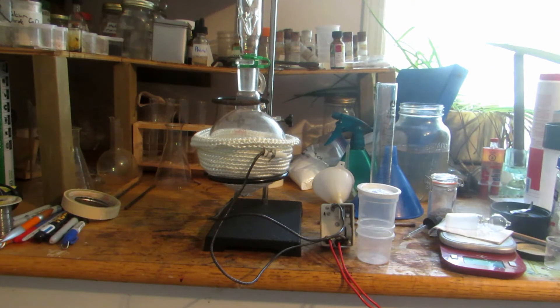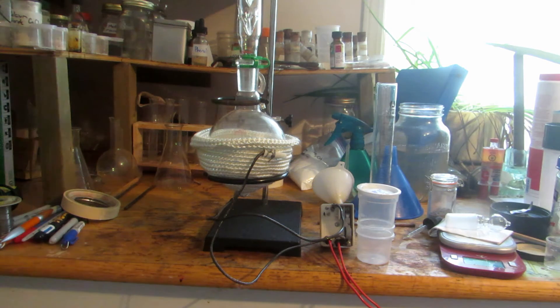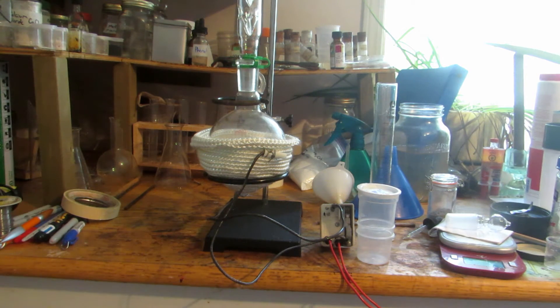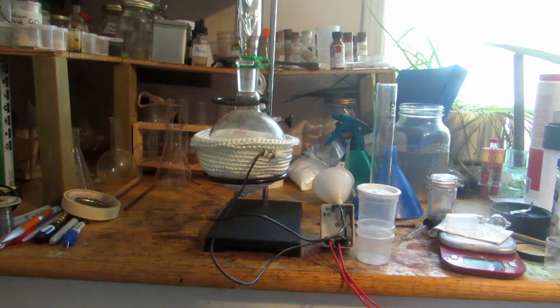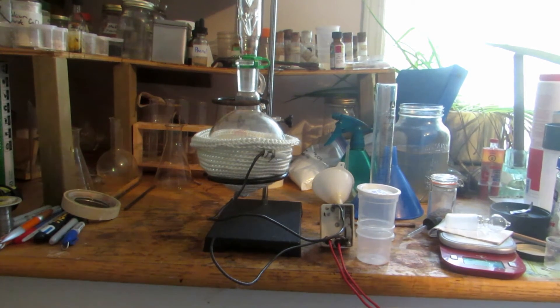I'm currently doing a distillation outside, so I'm using my distillation column. Instead, we'll use this fractional column as a condenser and keep the temperature low enough so the methanol doesn't boil off. We're going to start heating this until it refluxes for about two hours.